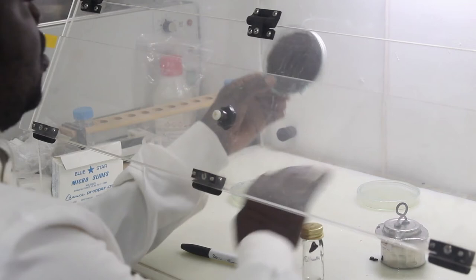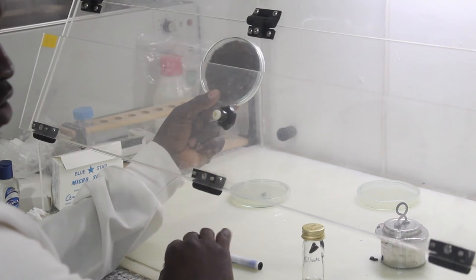This is from a ten-day-old culture which was cultured for the purpose of this demonstration.